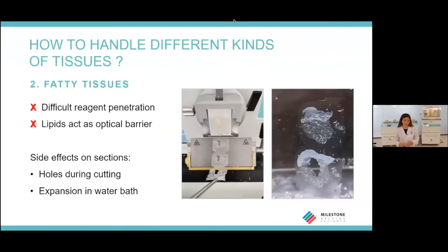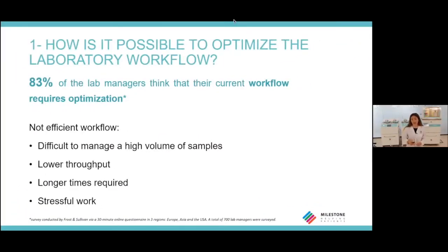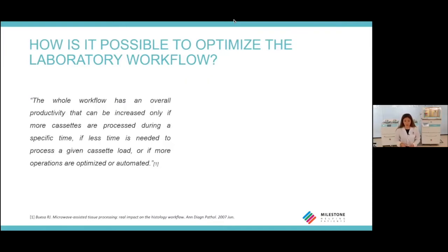If a fatty sample is not correctly treated, problems are present during the cutting of the block for sure. Sections may present holes, and the tissue tends to separate from the paraffin and expand in the water bath, like we can see in this image. Also, very important from the microscopic point of view, we can see the adipose tissue as a dense adipocyte network. So the question is how we can try to optimize the laboratory workflow.